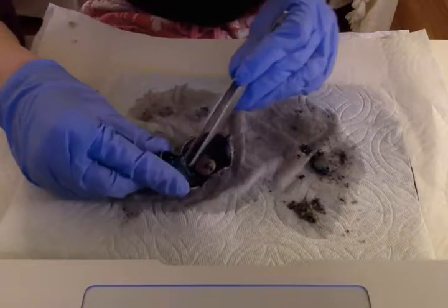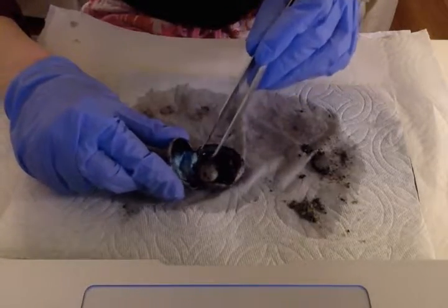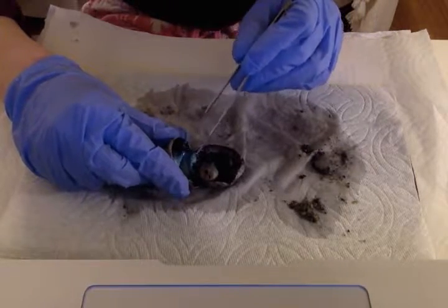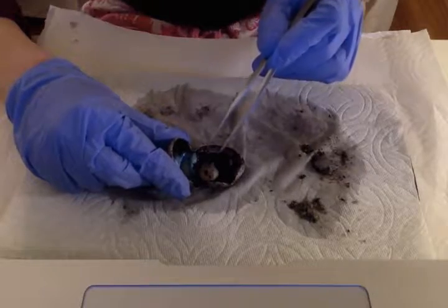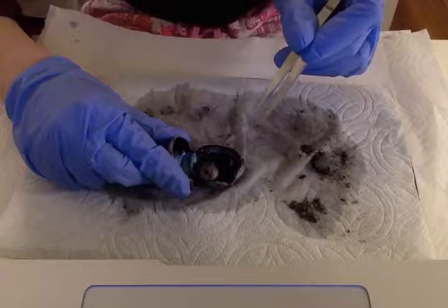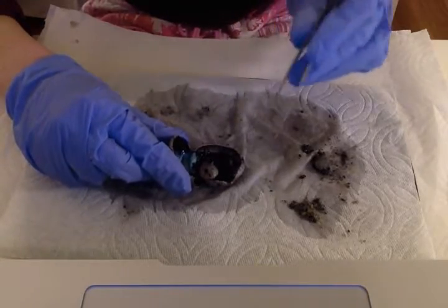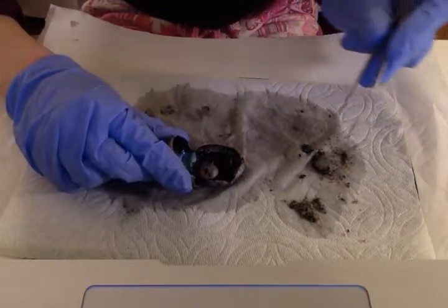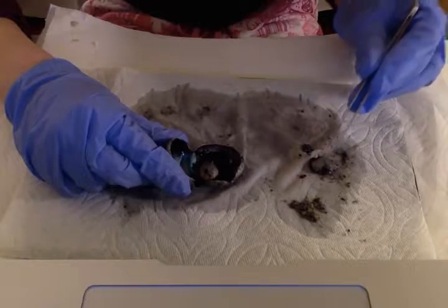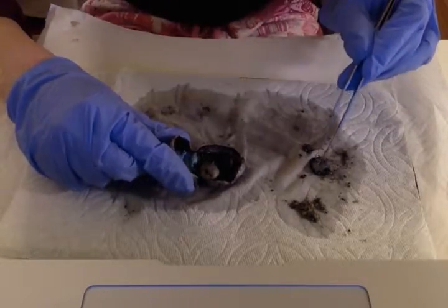Anyway, the area behind the lens that extends to the posterior side of the eyeball, where the retina is located, is called the vitreous chamber. This chamber is filled with the vitreous humor, also called the vitreous body, a clear, jelly-like matrix that maintains the shape of the eye. I actually kept it right here. I'm not sure how well you can see it, but I'm pushing on it. It's just this jelly-like substance.